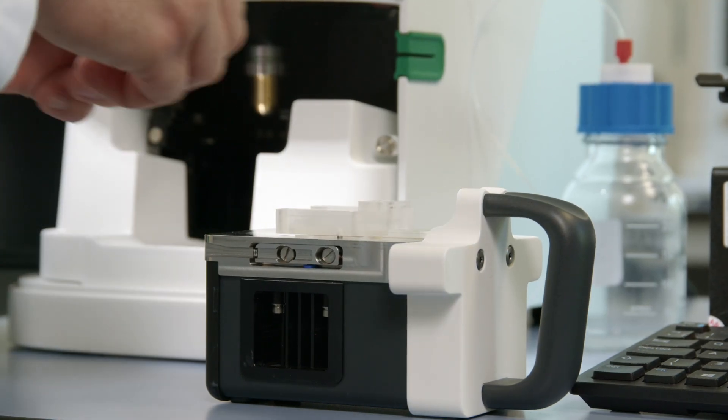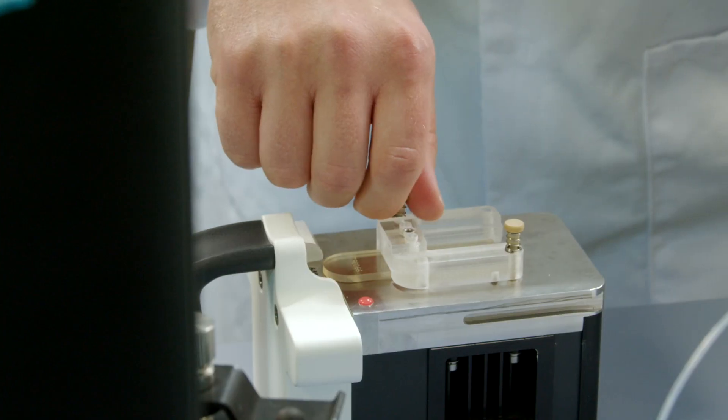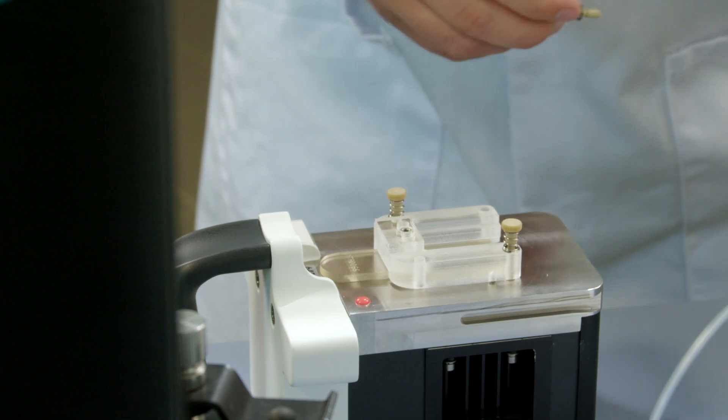Then we've got our screws as well can be held in the instrument. We just screw these in, secure the flow cell to the laser module. There's two in each opposite corner.